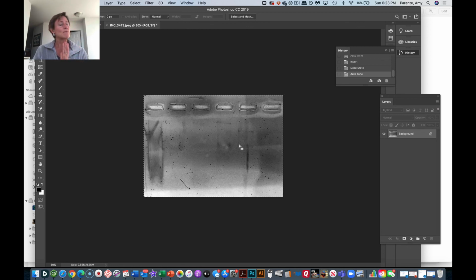So what I want you to do, and I'm totally fine right now if you just do this on a piece of paper, is this how you do it normally. Maybe by the time we get to our protein gel, I'll have an opportunity to show you how to do this digitally. You can take this and print it out. If you'd like to just handwrite, you can do it digitally on an iPad if you have it, or print it out on a piece of paper and write.